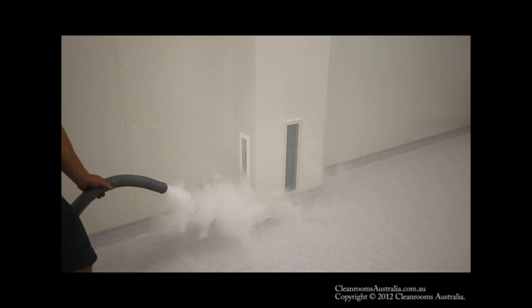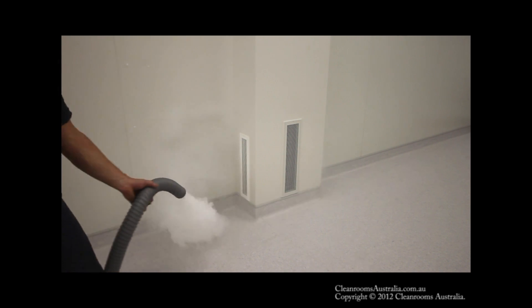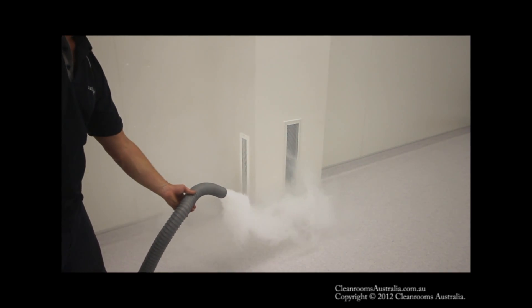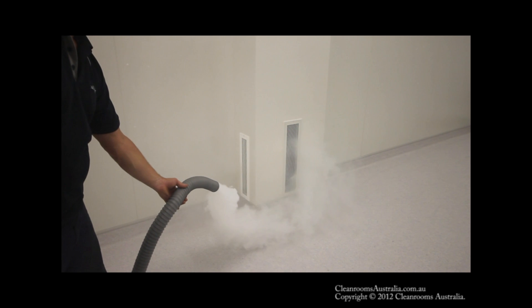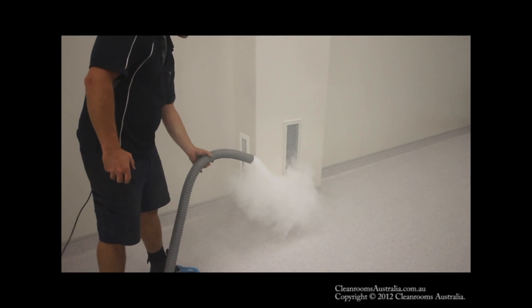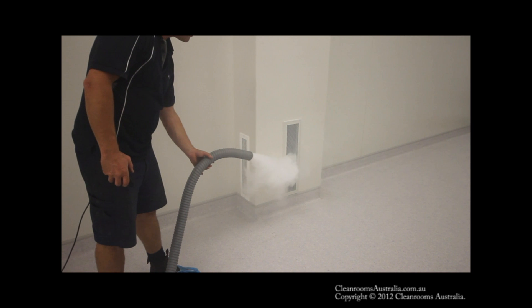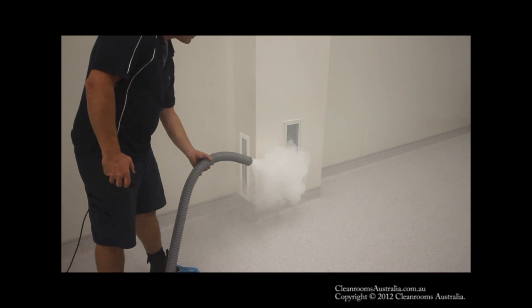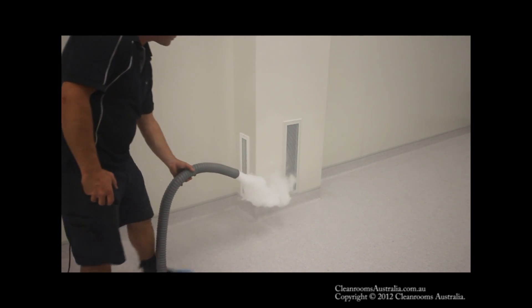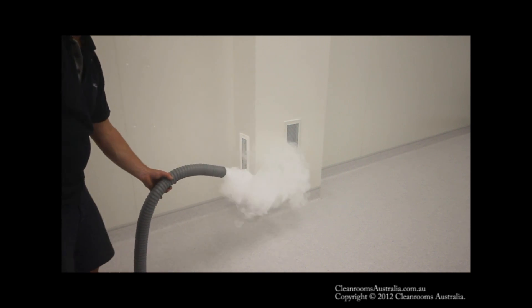If you don't get a take within one or two shots, and it's a mixed flow area, the smoke will disseminate across the clean room and you won't be able to get the shot very well. The idea is that you wait for the recovery of the room, and once the room is recovered you then take the shot.